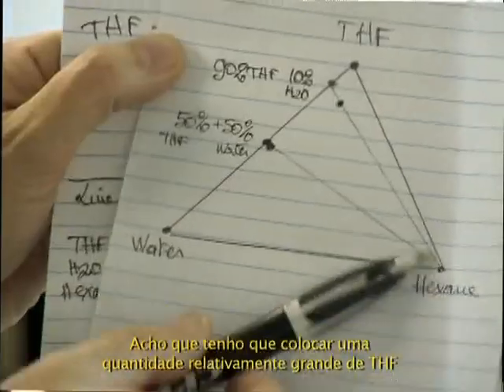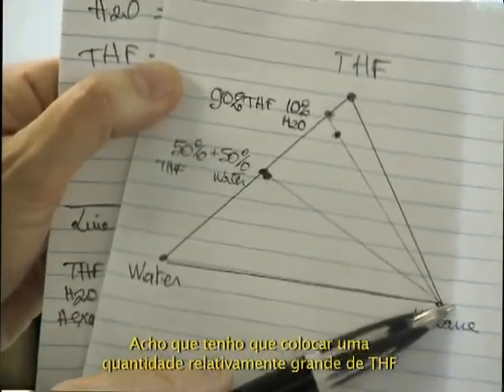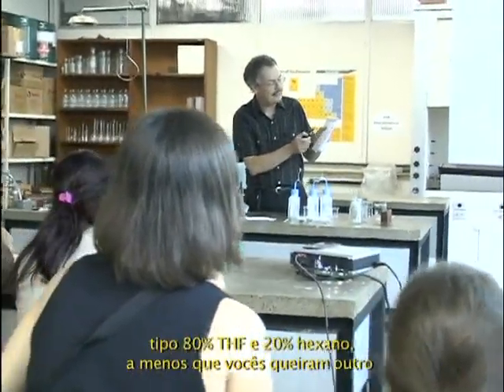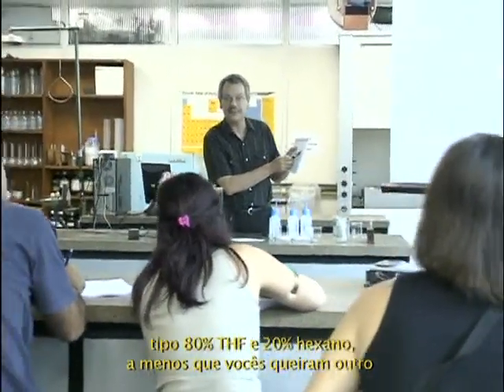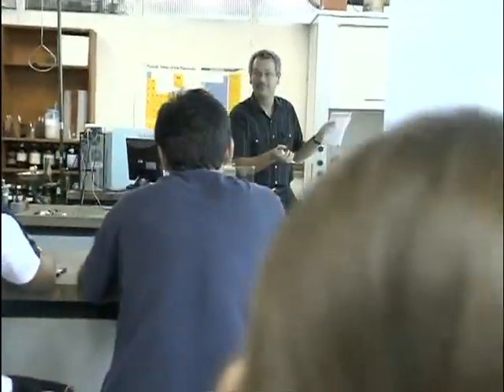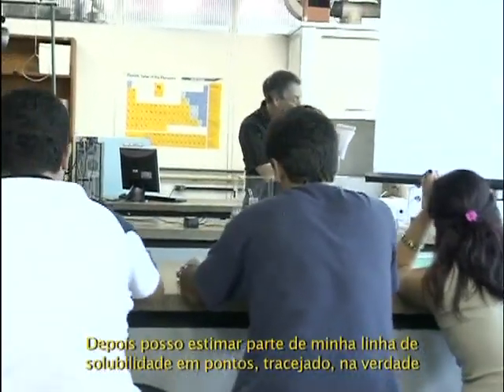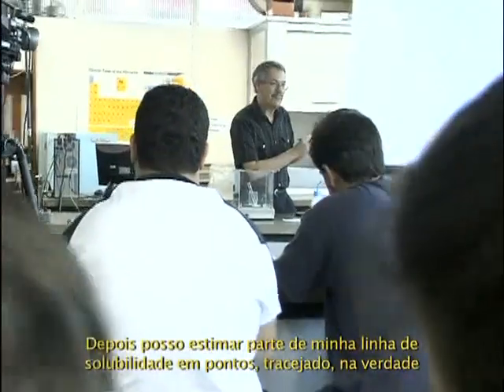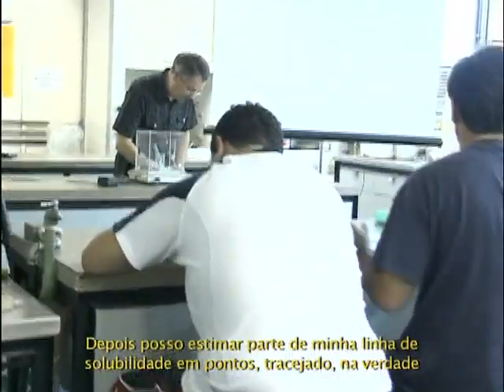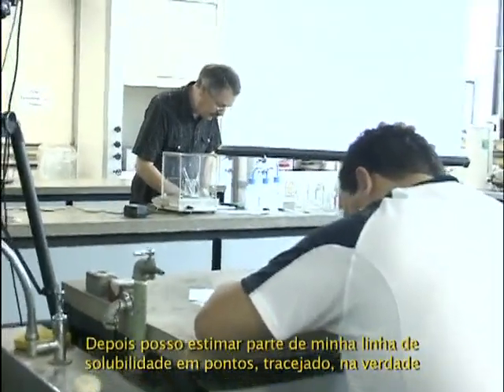So I think I have to put a relatively large amount of THF. So let's try a kind of 80% THF, 20% hexane, unless you want another one. Then I can estimate part of my binodal curve in dash actually.